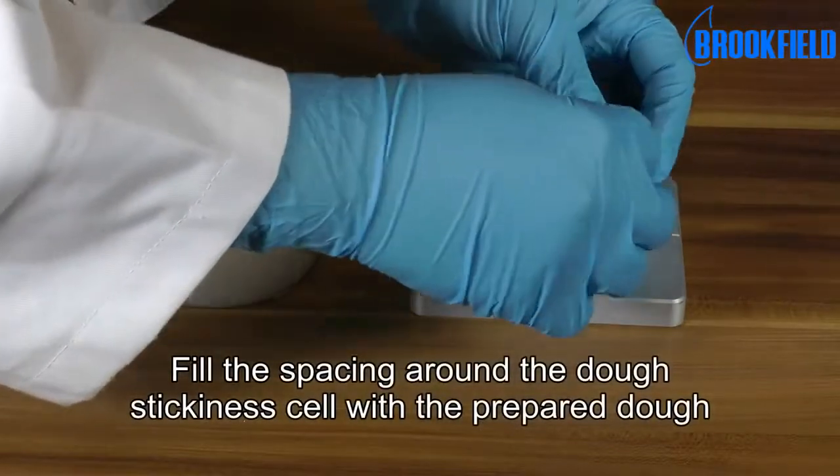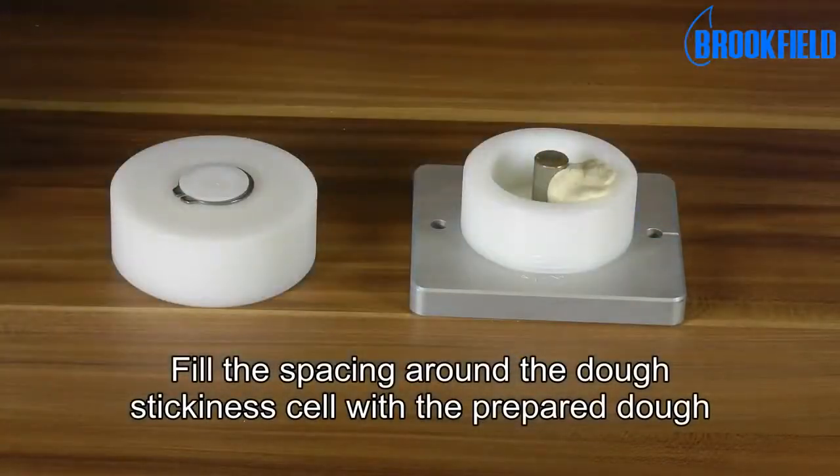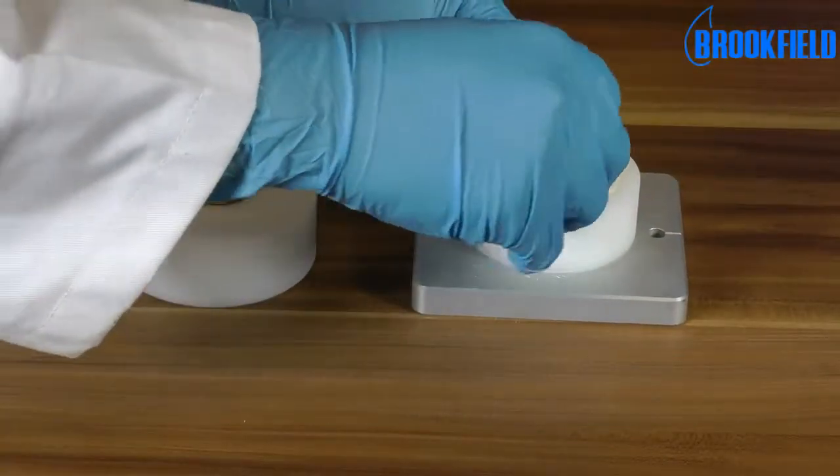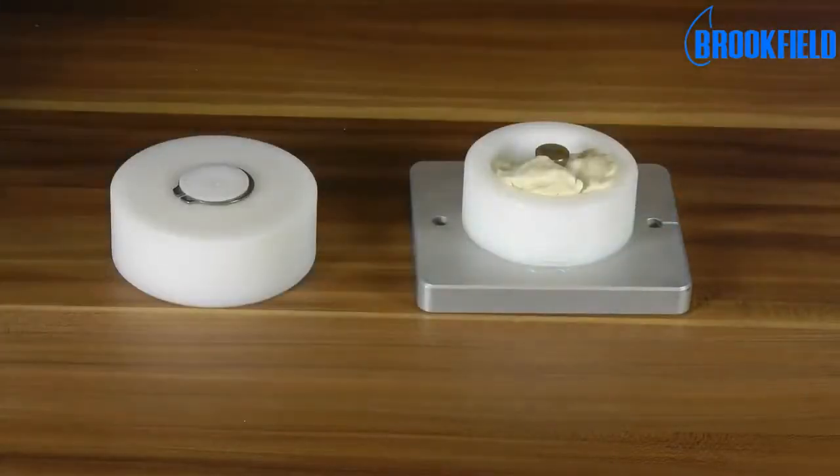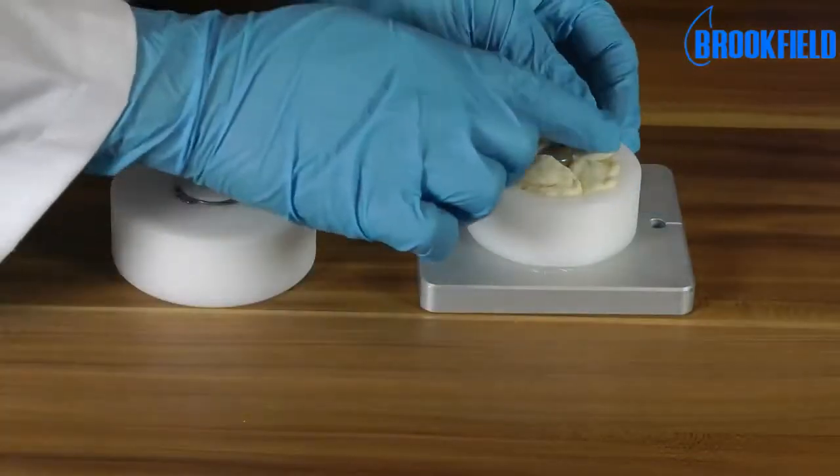To set up the test, fill the spacing around the dough stickiness cell with the prepared dough.